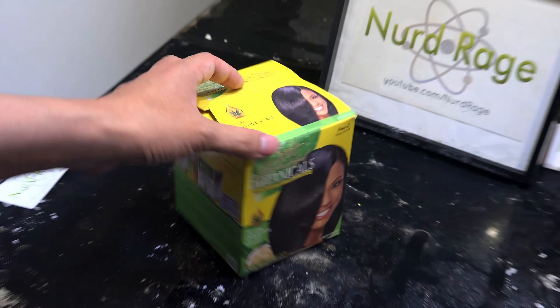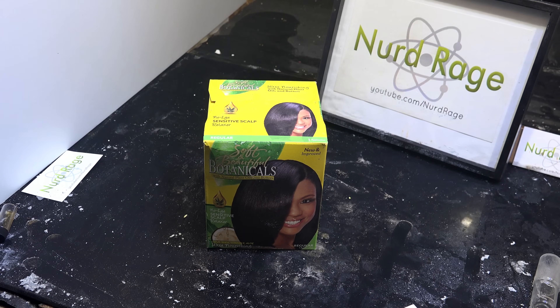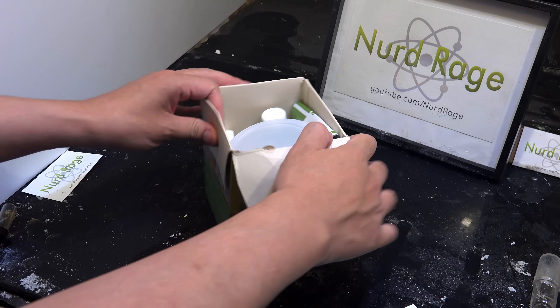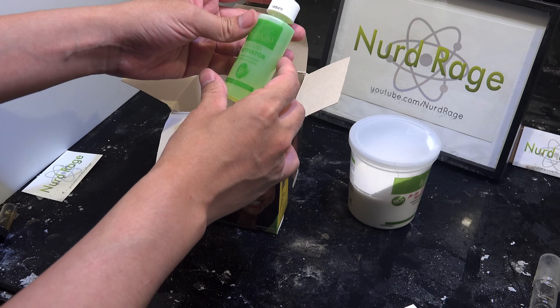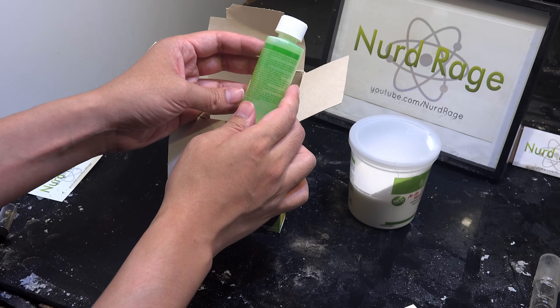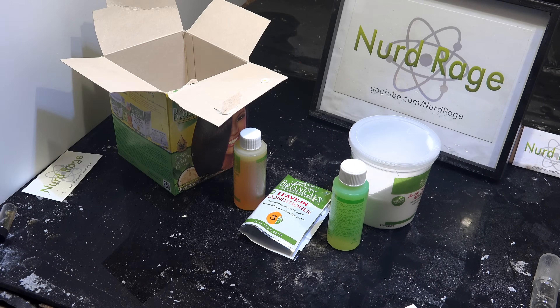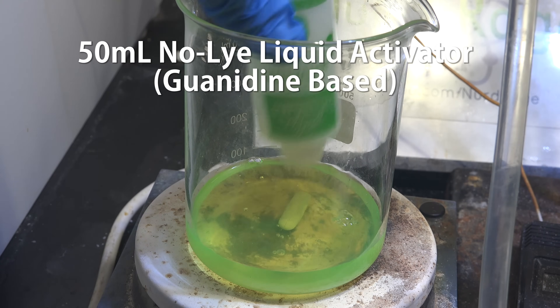Let's unbox our hair relaxant. There are actually a lot of extra products like activators, shampoos, and washes, but we just want the component that has our guanidine. And here it is — the liquid activator, as it's called. Doesn't look like much; let's see what we can get out of it. Pour all of the liquid activator into a beaker.